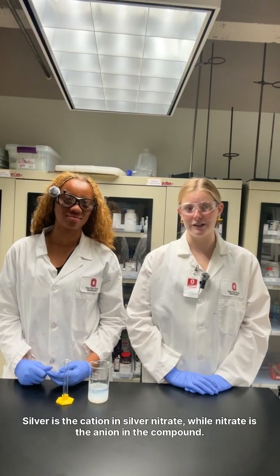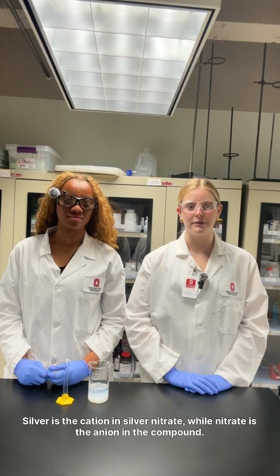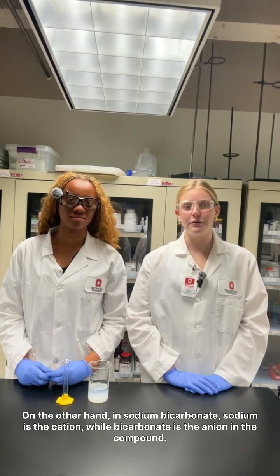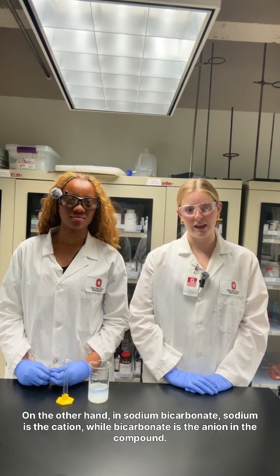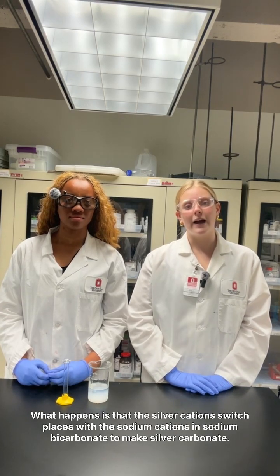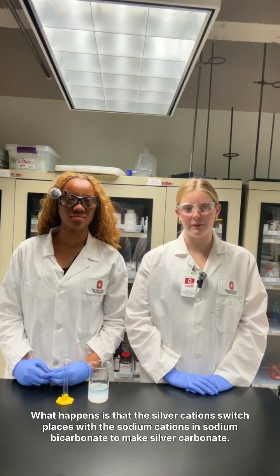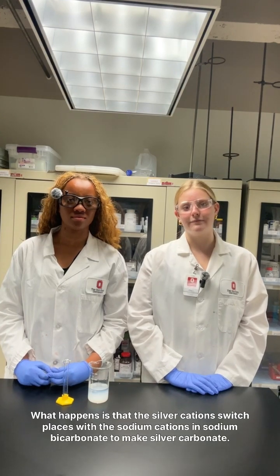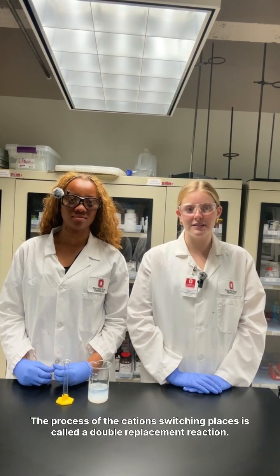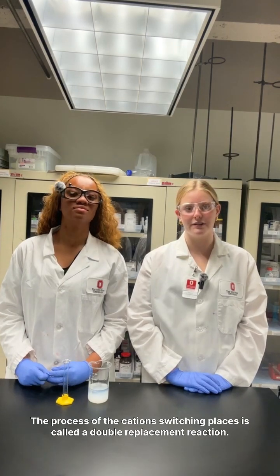Silver is the cation in silver nitrate, while nitrate is the anion in the compound. On the other hand, in sodium bicarbonate, sodium's the cation, while bicarbonate is the anion in the compound. What happens is that the silver cations switch places with the sodium cations in sodium bicarbonate to make silver carbonate. The process of the cations switching places is called a double replacement reaction.